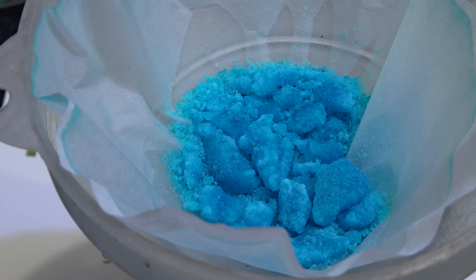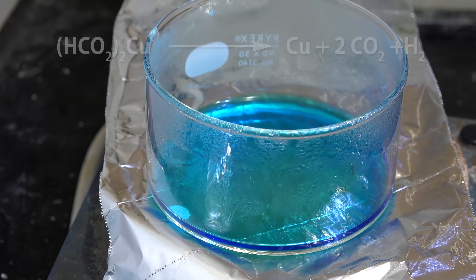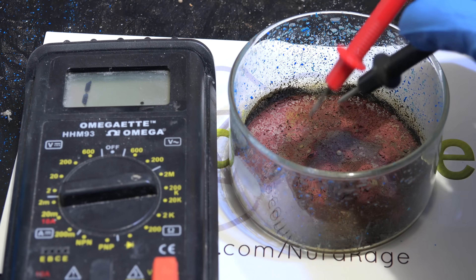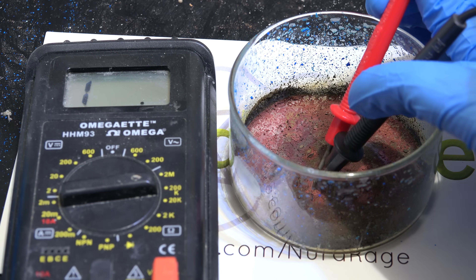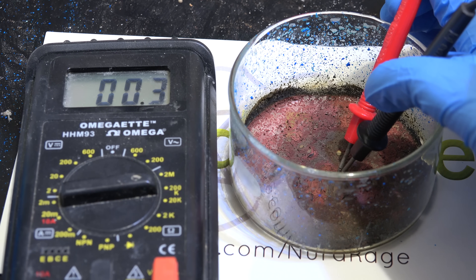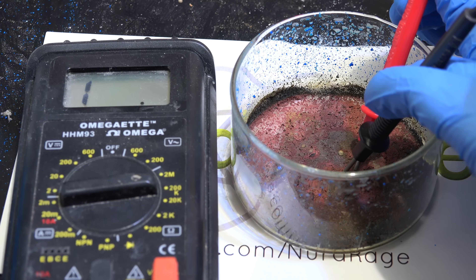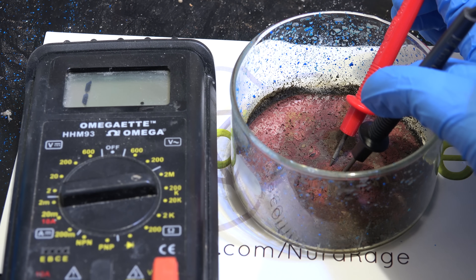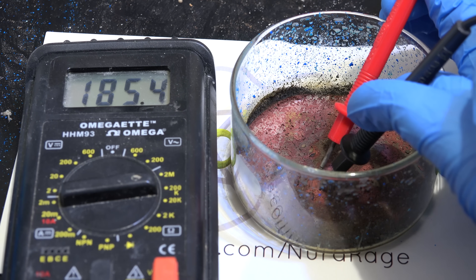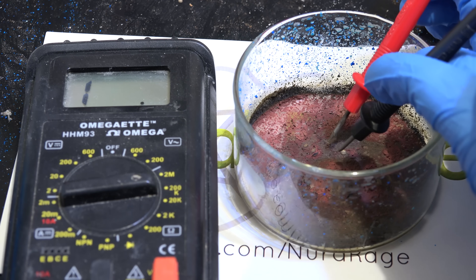So what can we do with this? If you get a solution of it and heat it up past 200°C, the copper formate decomposes into copper, carbon dioxide, and hydrogen gas. The copper produced isn't anywhere near as solid or high quality as what was produced with silver conductive ink. As you can see I can get brief flashes of conductivity but nothing reliable — the particles don't seem to be all that well bonded. But I'm hoping this low-level copper powder is still good enough for something called through-hole plating, a process electrical engineers use to make printed circuit boards. I'll cover that in an upcoming video.